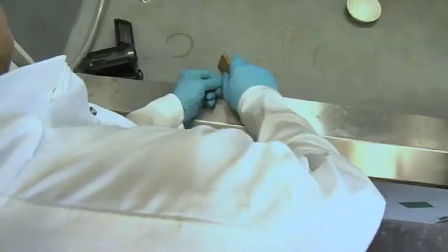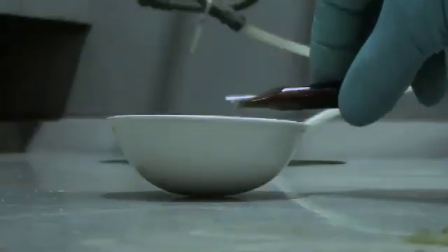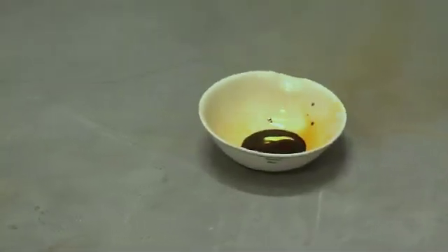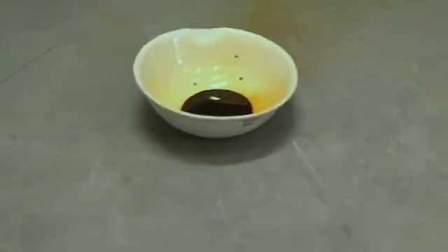Neil is now using a glass knife to open the ampoule, and he's going to pour the liquid bromine into this small evaporating dish inside our fume hood. Now, instantly you can see the vapour of the bromine coming off — you see all these really nice orange fumes coming off from the liquid, and then they're being drawn away by our fume hood.